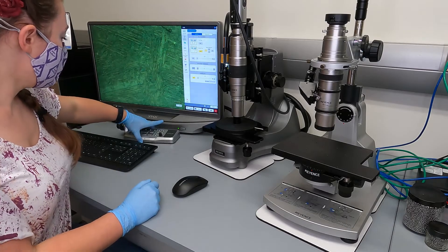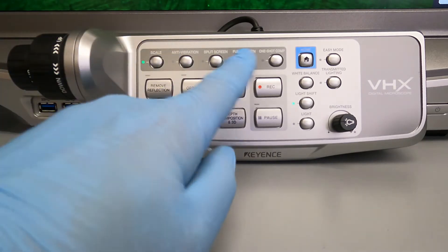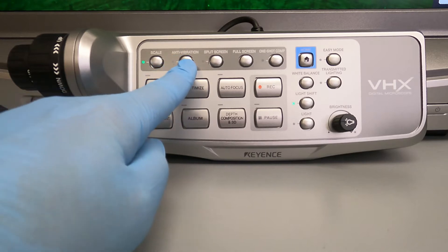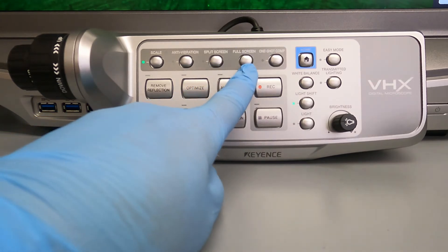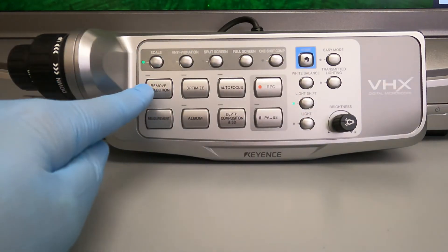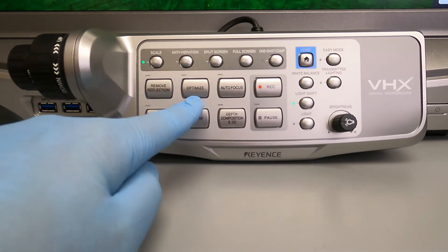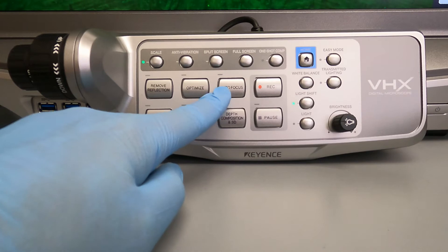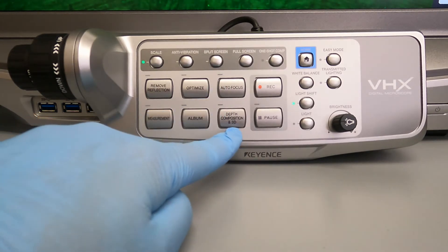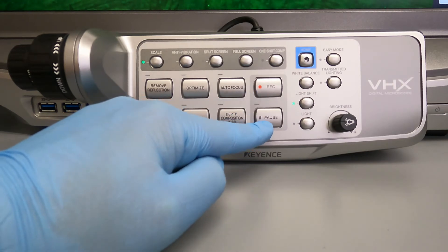Pretty much everything you can do on the console you can also do in the software, but the console is a nice shortcut. The two knobs — big and small — are coarse and fine focus. Across the top of the console: scale bar add/remove, anti-vibration on/off, split screen rotation, full screen, one-shot composition, remove reflection (like halation removal for shiny spots), measurement to open the 2D measurement window, optimize to bring up the nine lighting conditions, album for file folders, autofocus for the automatic lens, depth composition and 3D menu, record to capture and open the file folder for saving, and pause — which does not actually save anything.